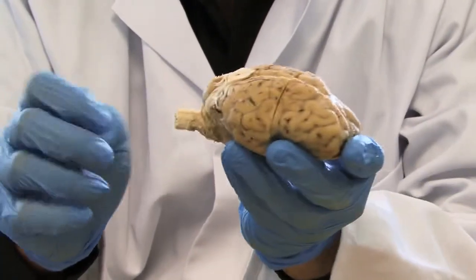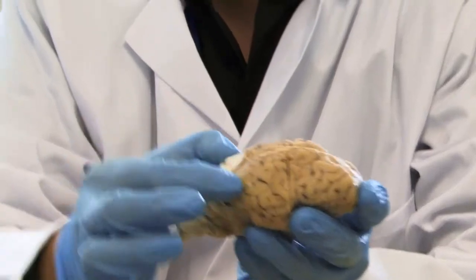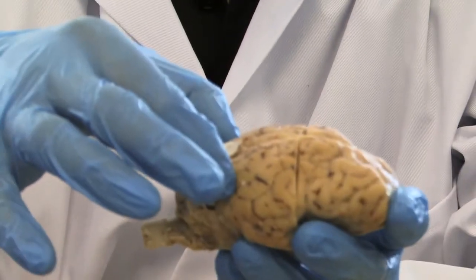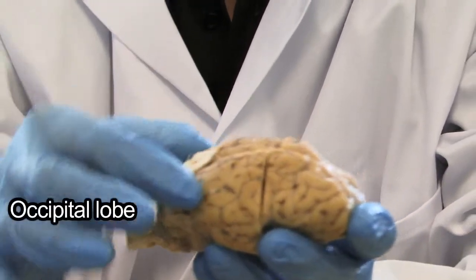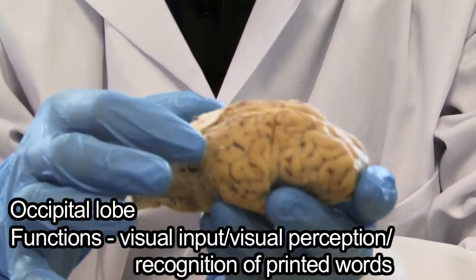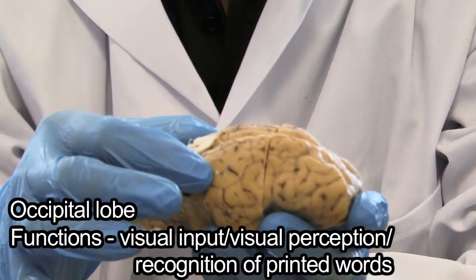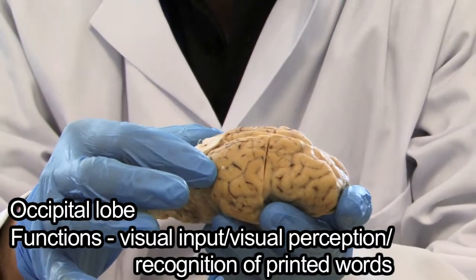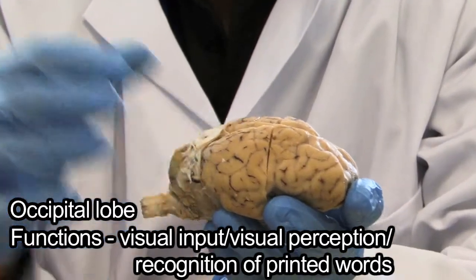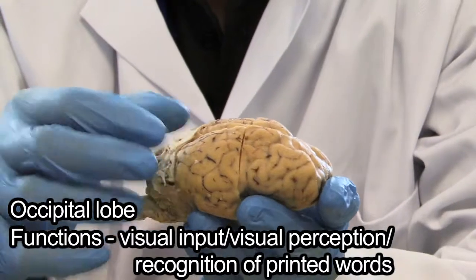The next area is this bit at the back of the brain over here, and this is referred to as the occipital lobe. The occipital lobe is for visual input, visual perception, and for recognition of printed words and anything that you can see.